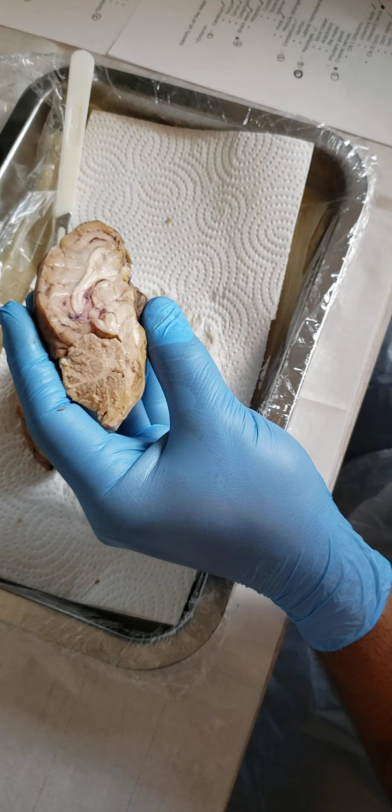First, looking at our olfactory bulb, it is right here, and if we were to connect them, you could see both of them right there. There's the olfactory bulb here, and the olfactory bulb on this side. The olfactory nerve is right in the bulb there. So there's that nerve. Next we have the optic nerve.